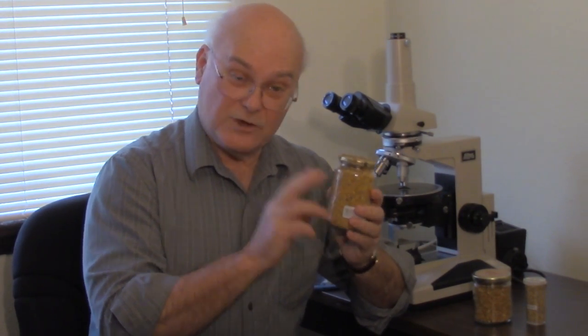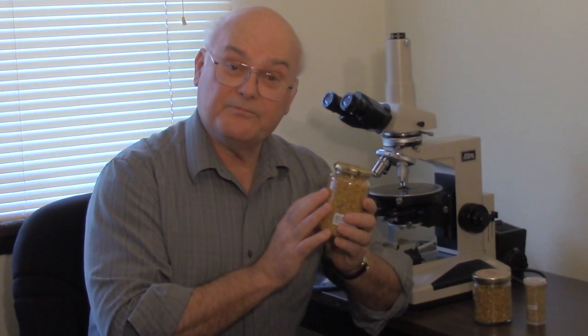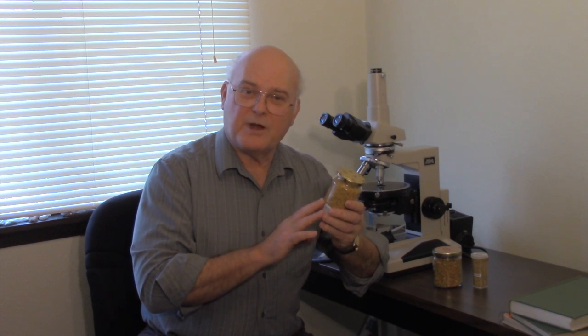Those samples require a little more work than these pollen grains. These pollen grains we can simply dissolve in a little alcohol, spread out on a microscope slide, and mount for analysis. We'll look at a couple of these different ways of preparing the pollen grains and talk about some of the advantages and disadvantages — but we'll do that in the next episode.